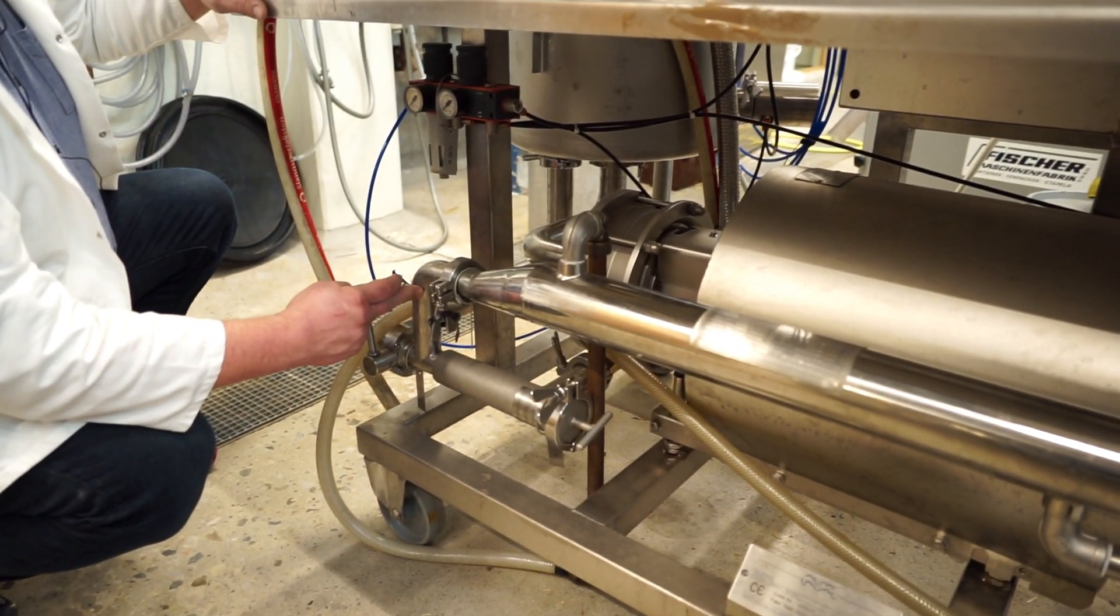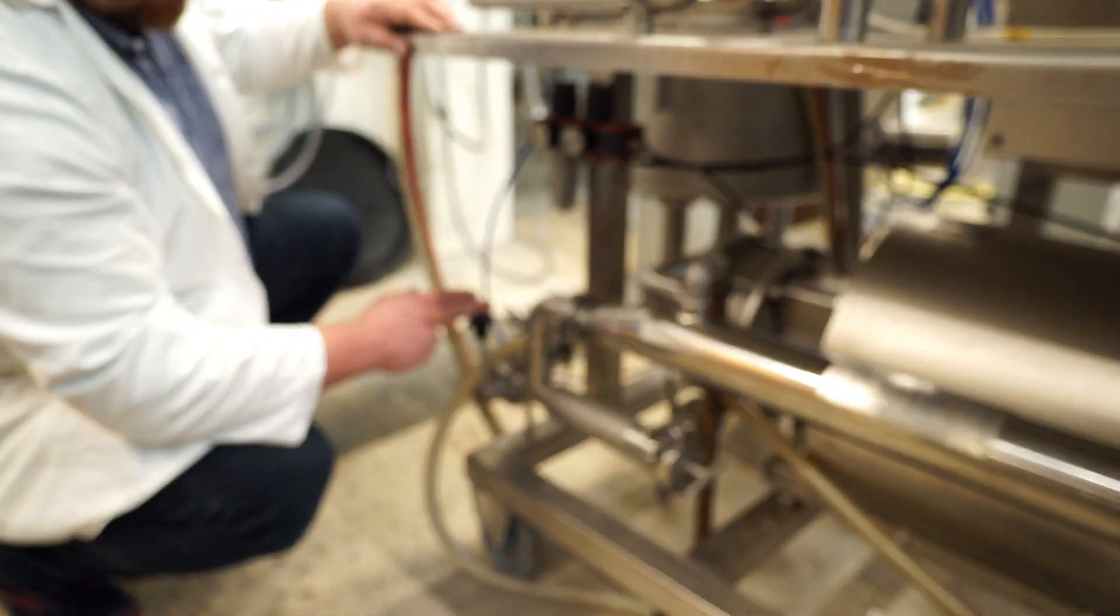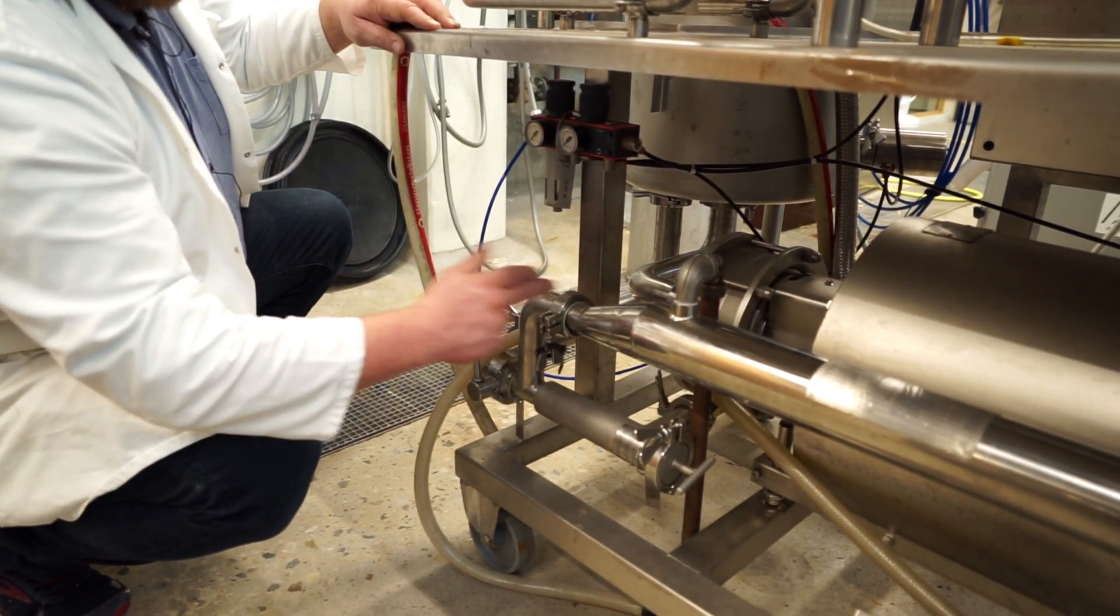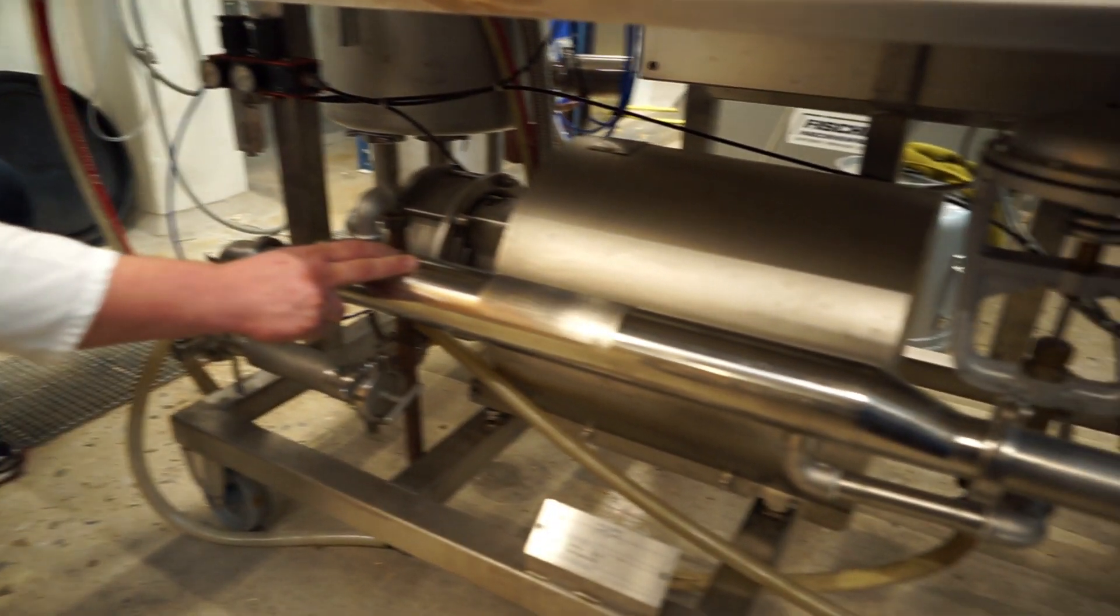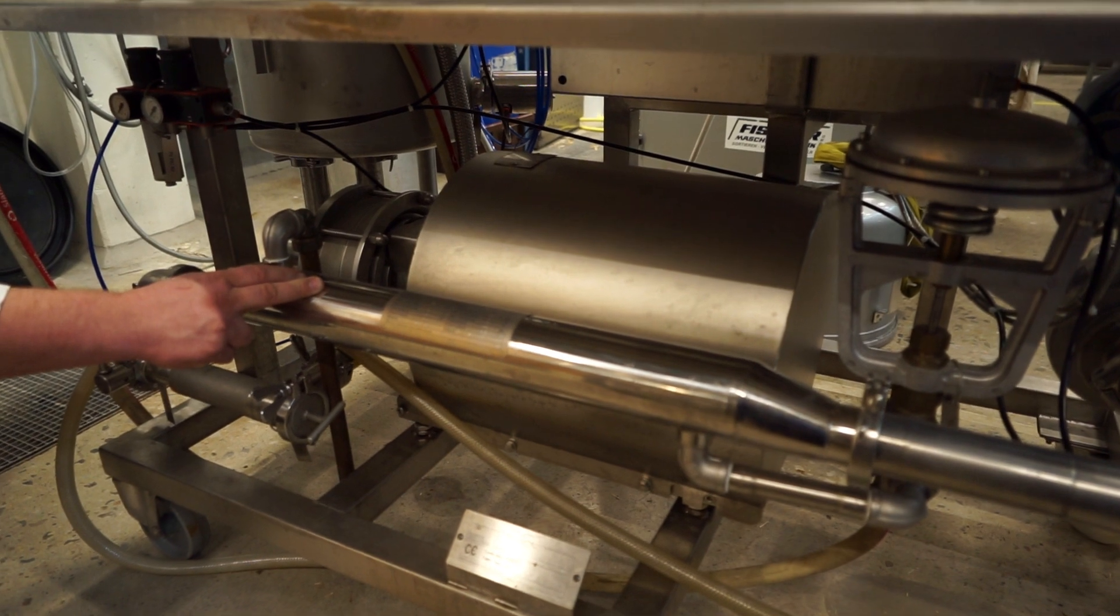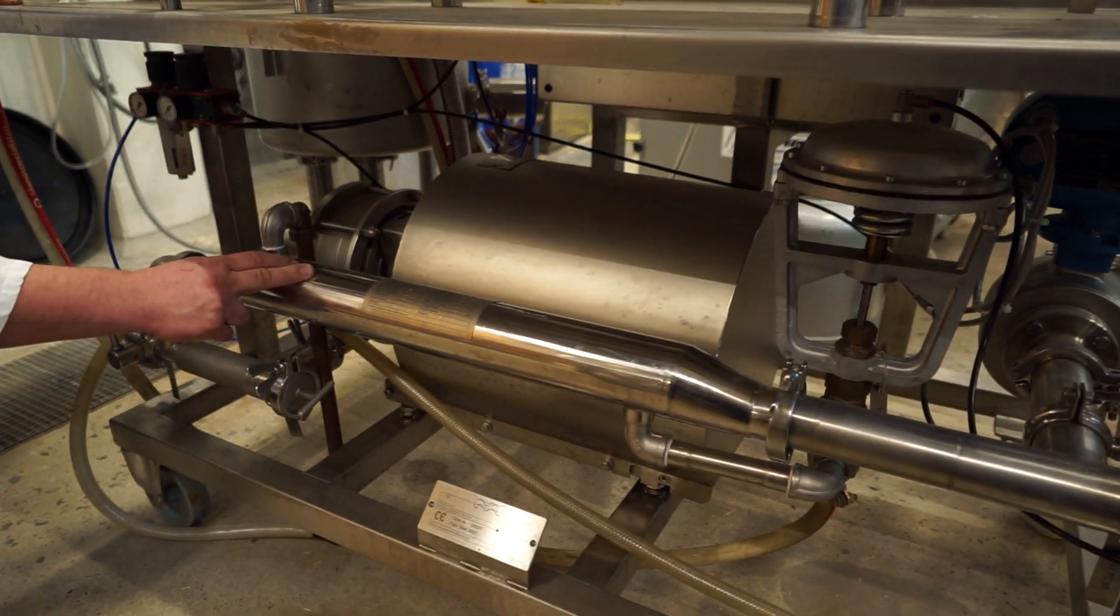The liquid comes here. This is a valve that is now closed. It goes through this, which is a heat exchanger, which we can use to also control the temperature of the solution.